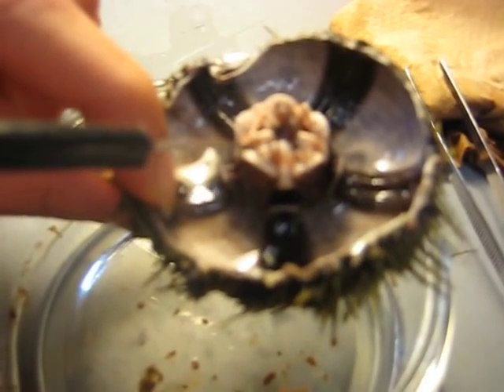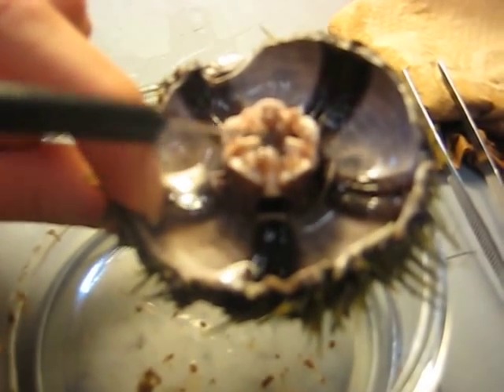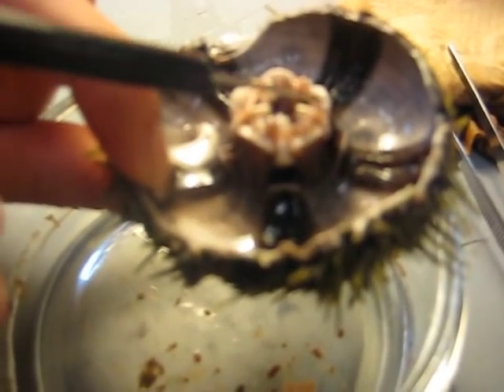It alternates so that here's a tooth and then these are the compass — a tooth and a compass. This kind of pinkish, purple-ish color, those are the muscles that attach to it as well.